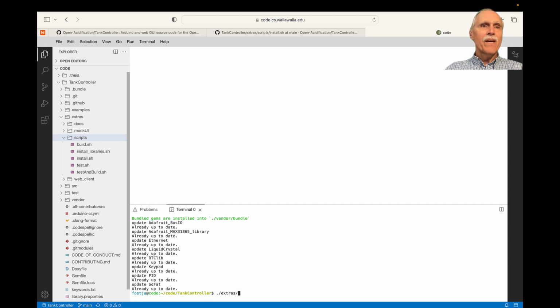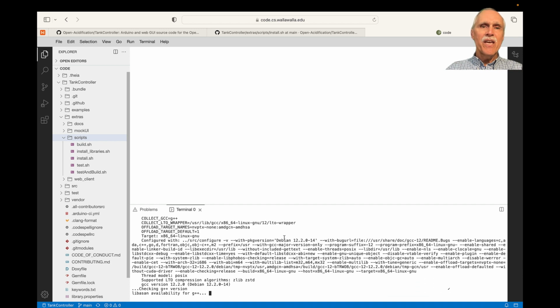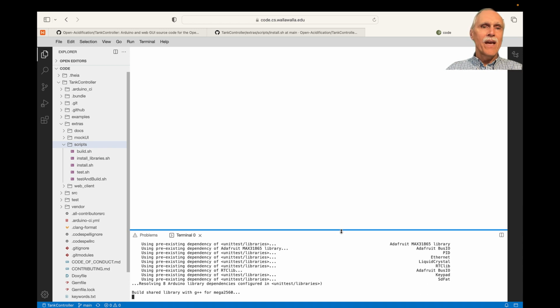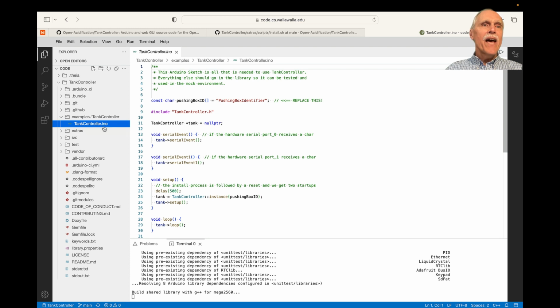/extras/scripts/test and build. That will start the Arduino testing framework. While that's running, we'll talk a little bit about the folders and files that exist in the project. An Arduino library comes with examples, and an Arduino application is a .ino file.